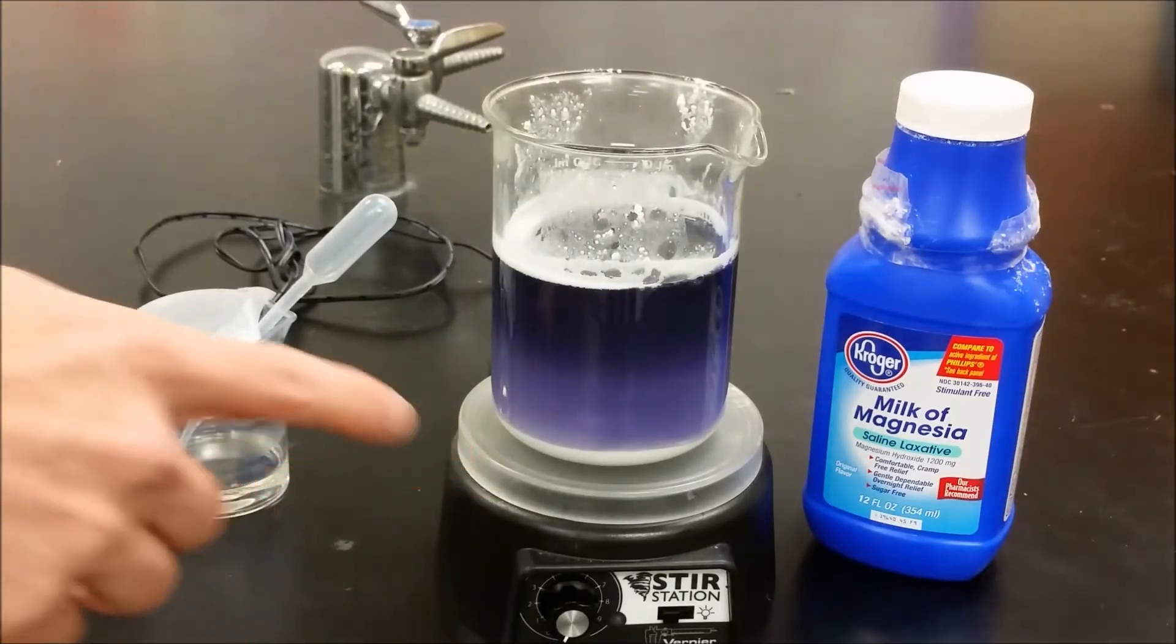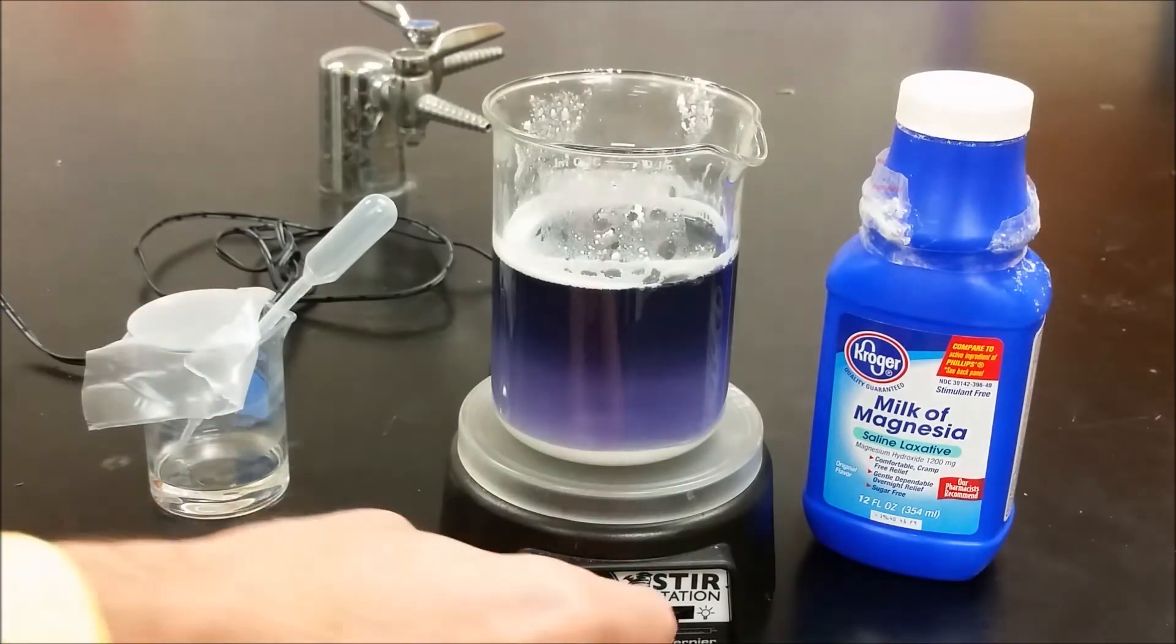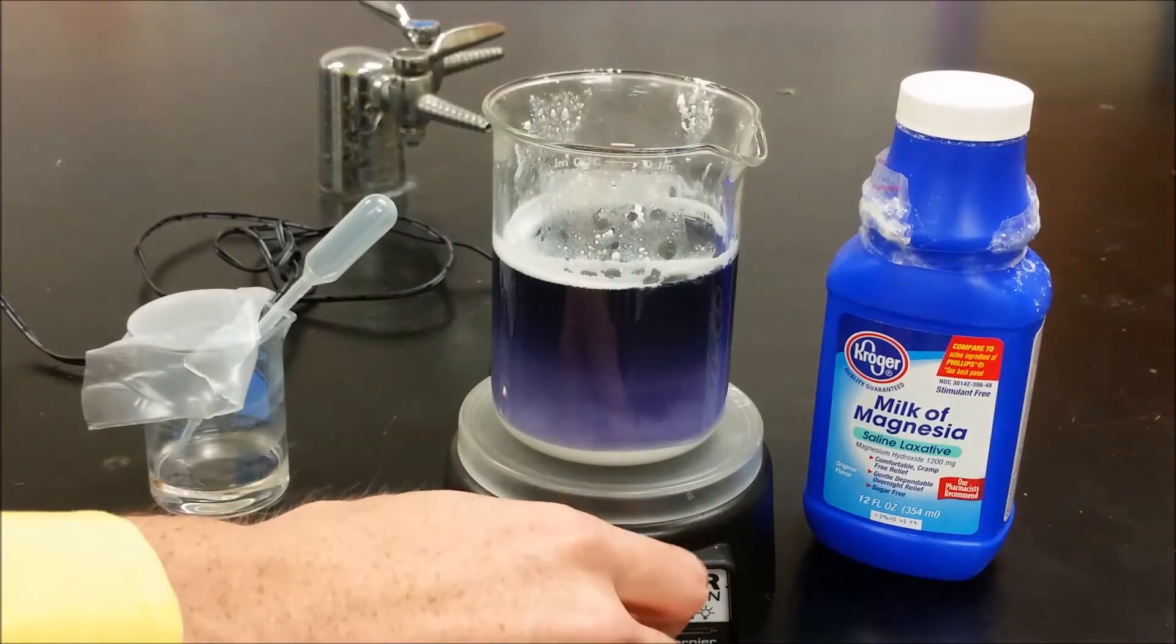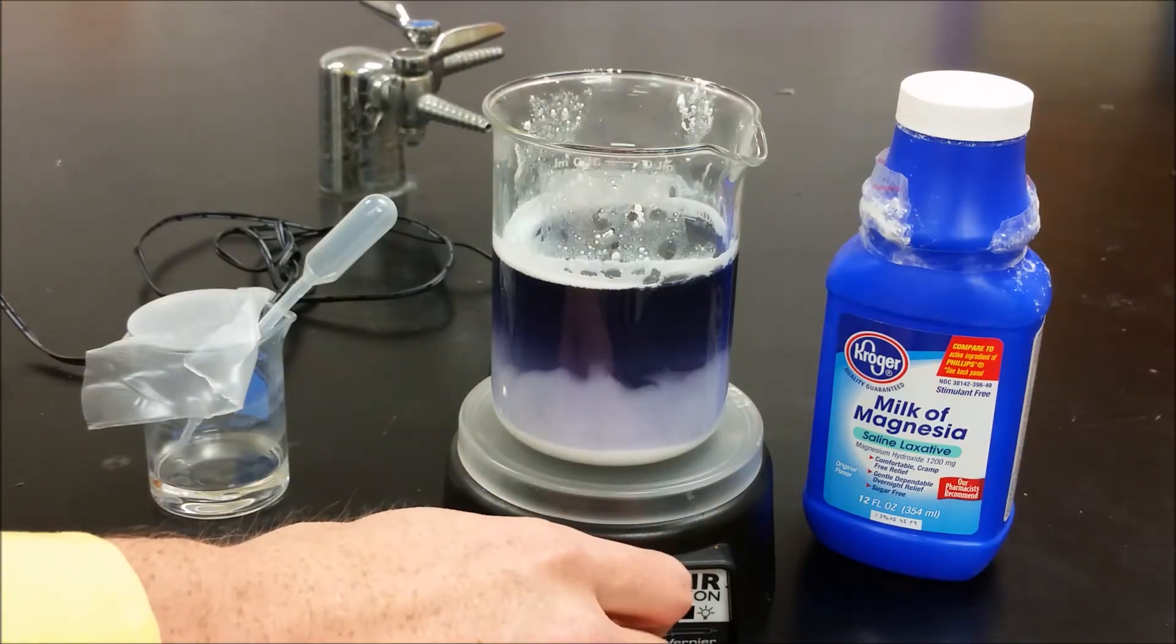Here we have some milk of magnesia dissolved in water with a little bit of Universal Indicator added. I'm going to turn this on and start to stir this suspension.